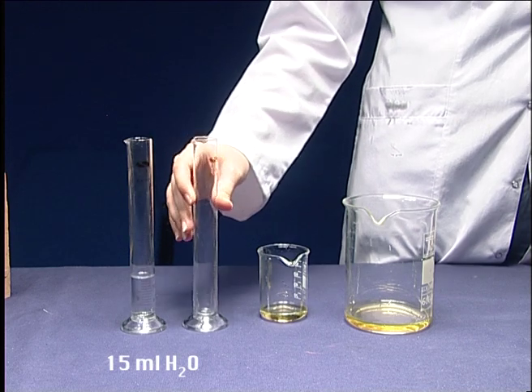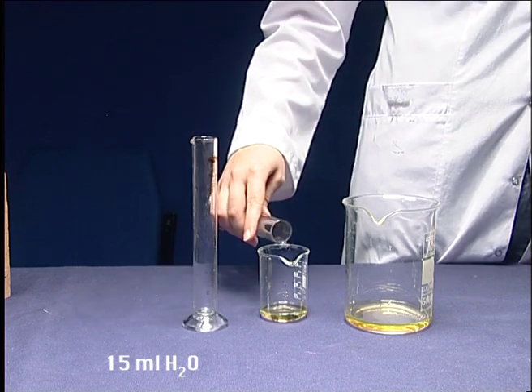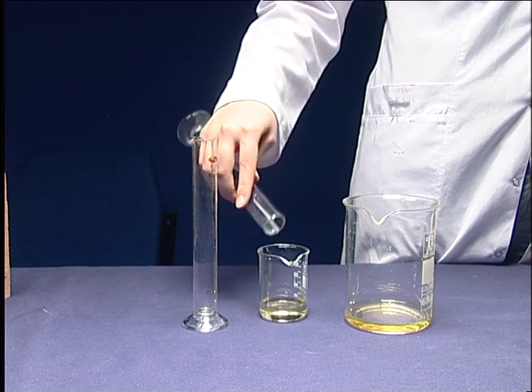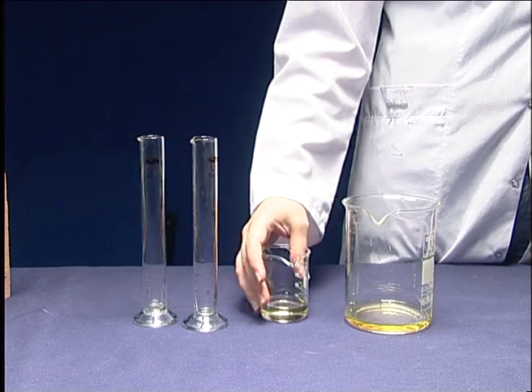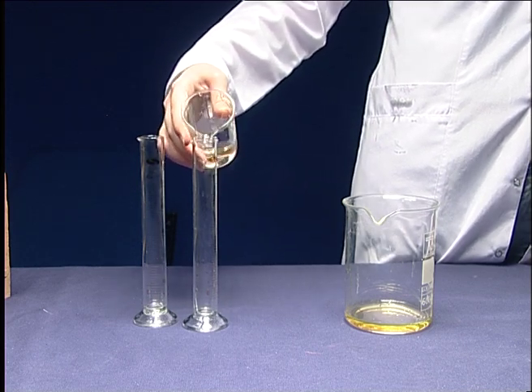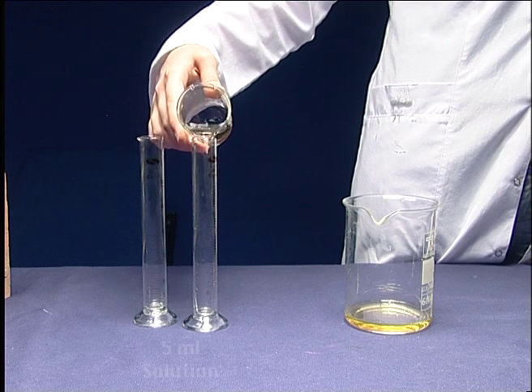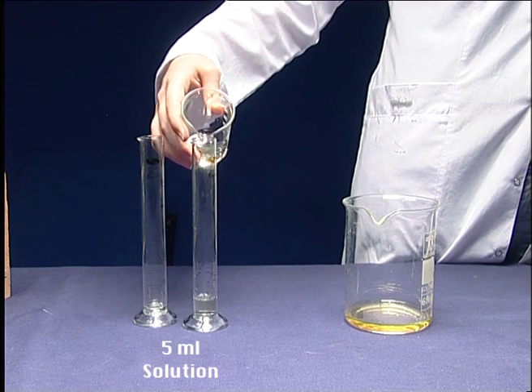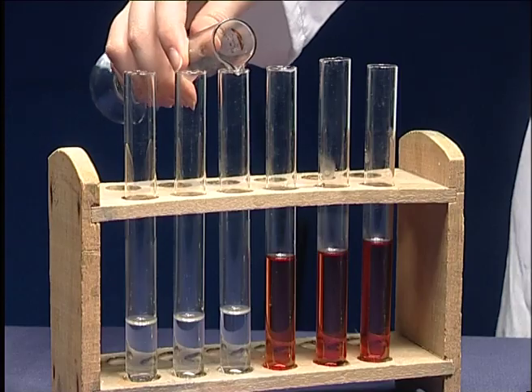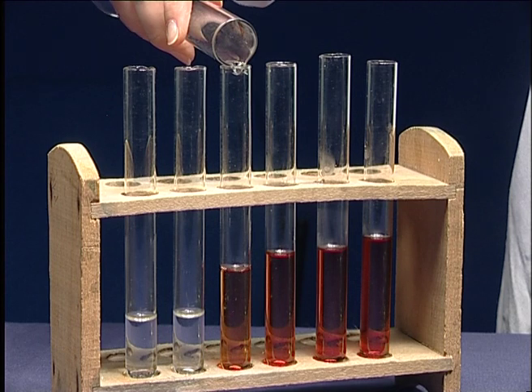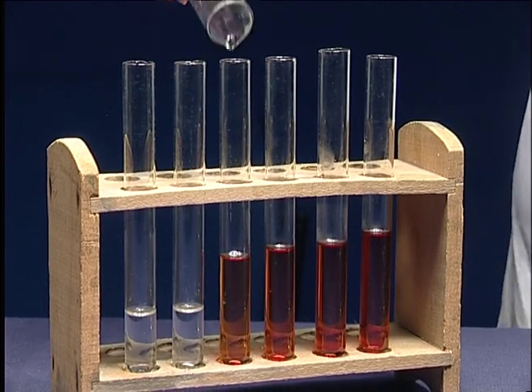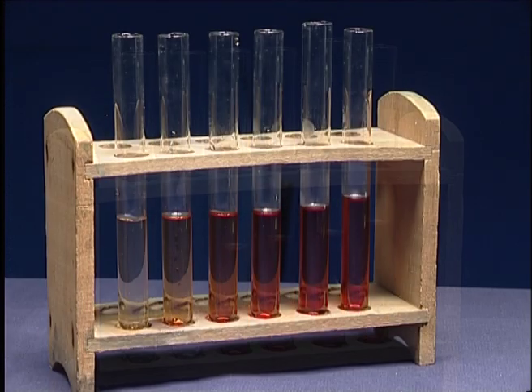Add 15 ml of water. Do the same procedure for all the other test tubes. Afterwards, add 5 ml of solution taken from the previous solution into the fourth test tube. Do the same procedure for the fifth and sixth test tubes.